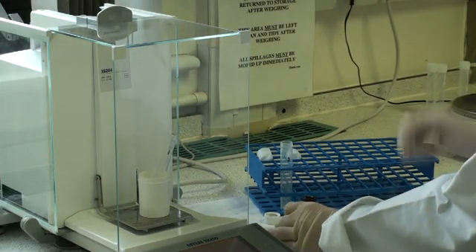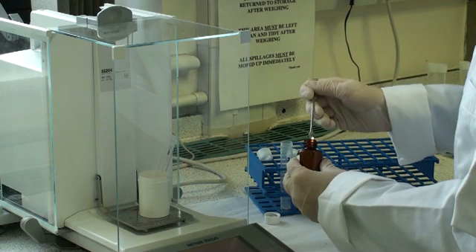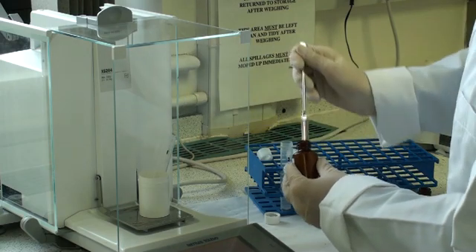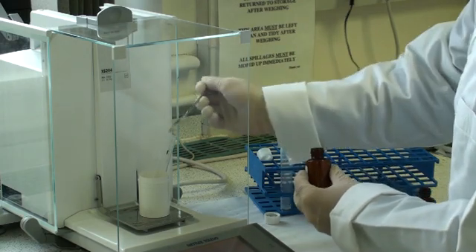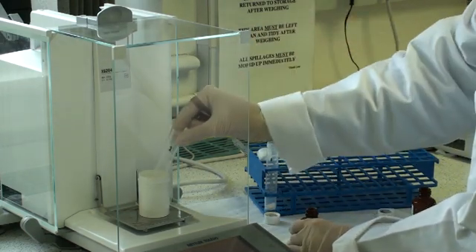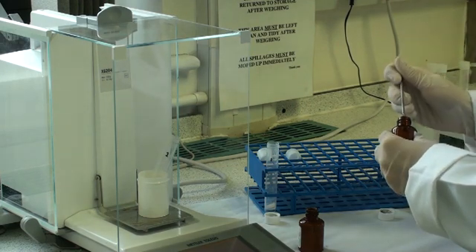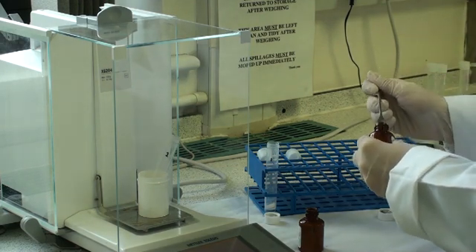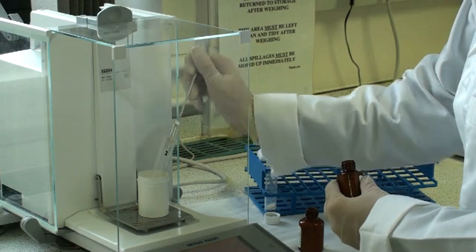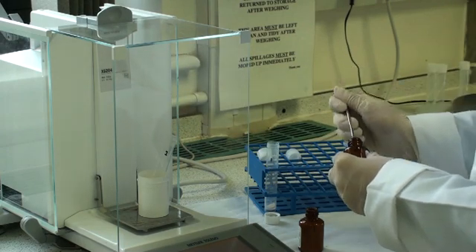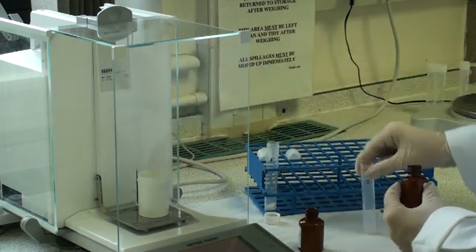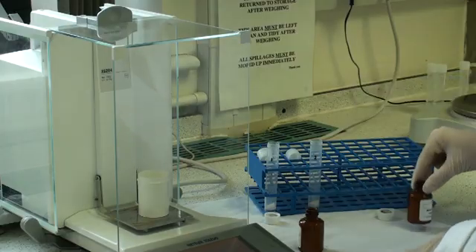Accurately weigh exactly 0.5 grams of flour sample into a 13mm polypropylene tube. After weighing, tap the tubes to make sure all the sample falls to the bottom of the tube.